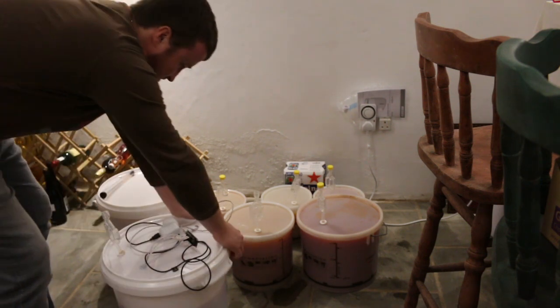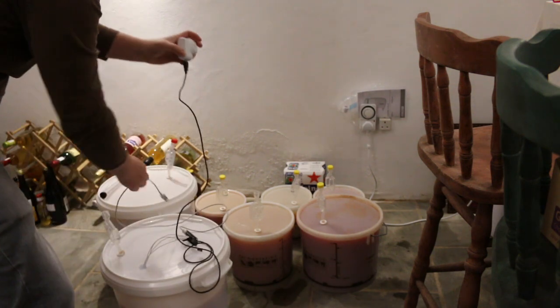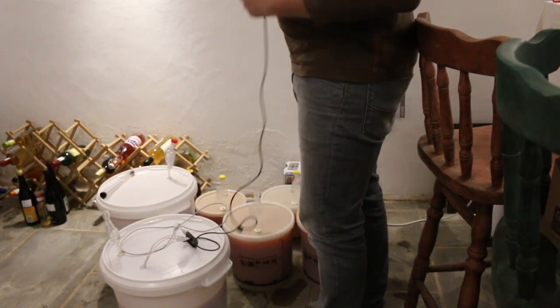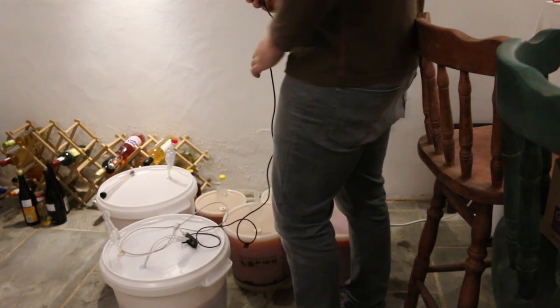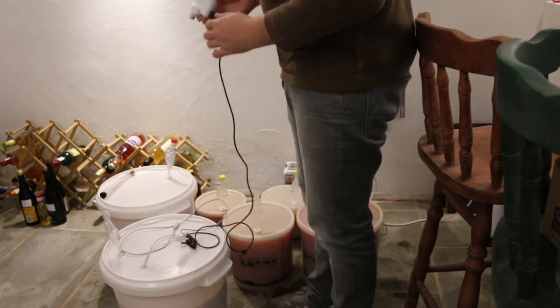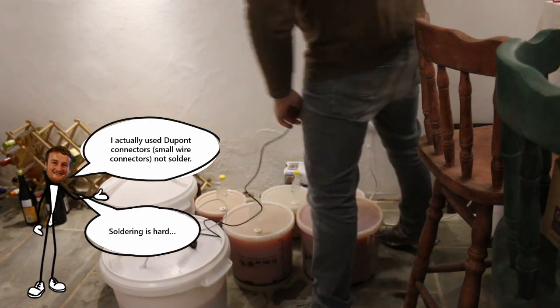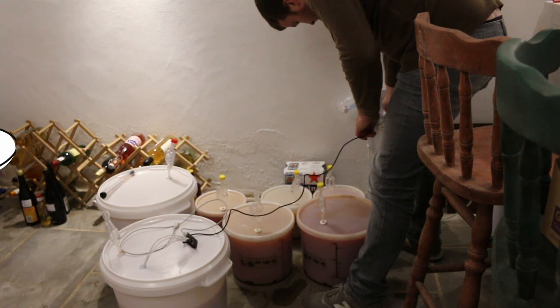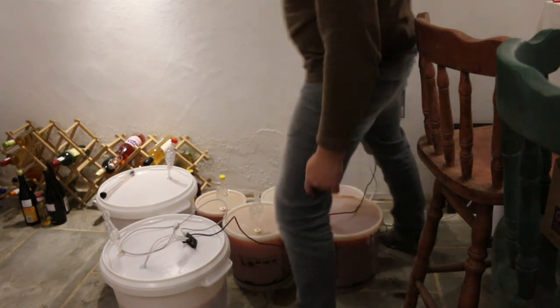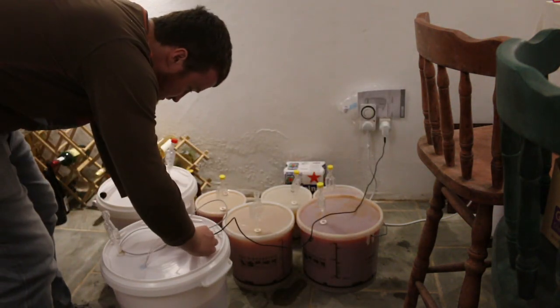Obviously you can't smell this, but it smells, as you'd imagine, very dry, very yeasty. But it'll be interesting. So anyway, the way this works is this has an external power supply just to help keep it running when I'm going off. This is just an old USB cable that we weren't using anymore, which I just snipped the ends off and soldered to the ESP. And then this is just an old power supply for something. Anyway, so the way this device works, I'll just make sure that that is.